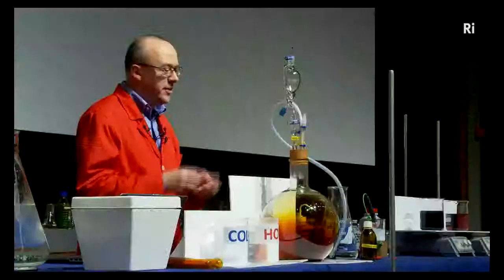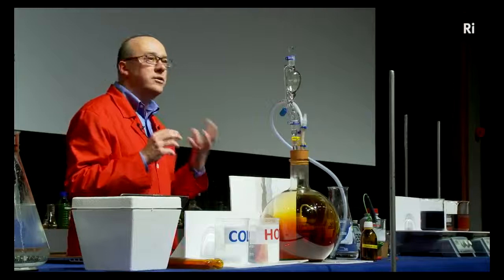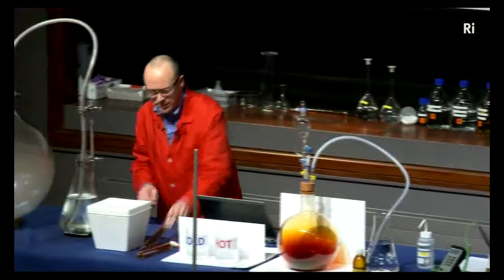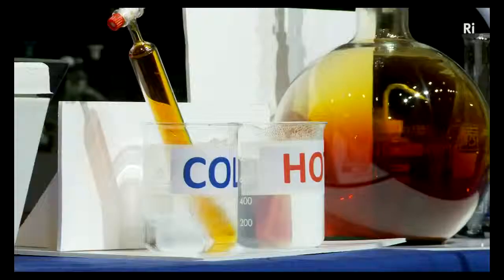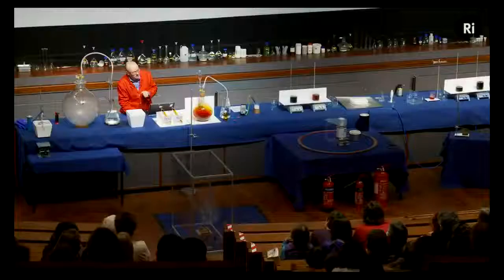Nitrogen dioxide is a material that can help us understand this question about whether a chemical reaction can go backwards. In these tubes we have equal amounts of nitrogen dioxide. I'm going to take one of the tubes and place it in iced water so that it will cool down, and the other tube I'm going to place in hot water to heat it up. We'll come back in a moment and see if they've changed in any way.